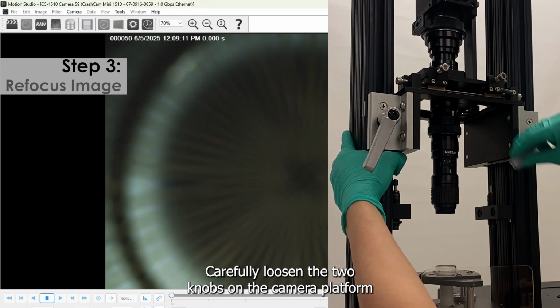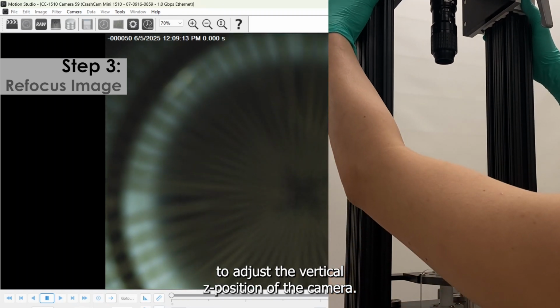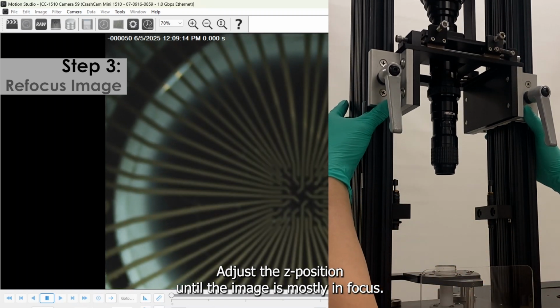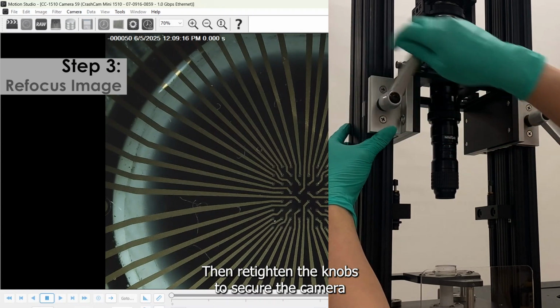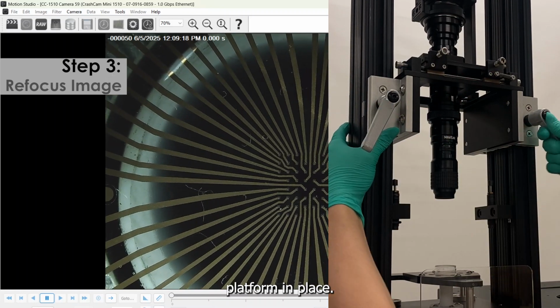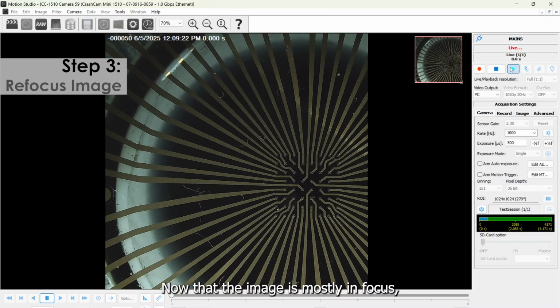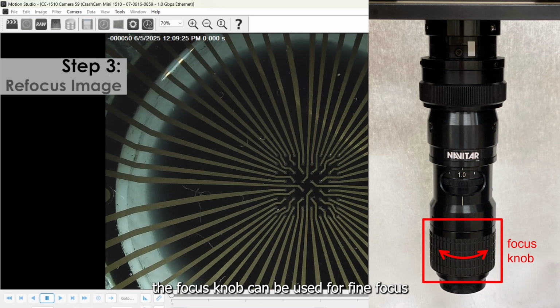Carefully loosen the two knobs on the camera platform to adjust the vertical Z position of the camera. Adjust the Z position until the image is mostly in focus, then retighten the knobs to secure the camera platform in place. Now that the image is mostly in focus, the focus knob can be used for fine focus adjustments.